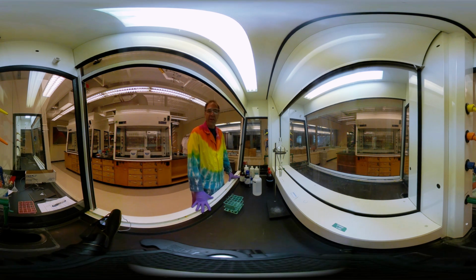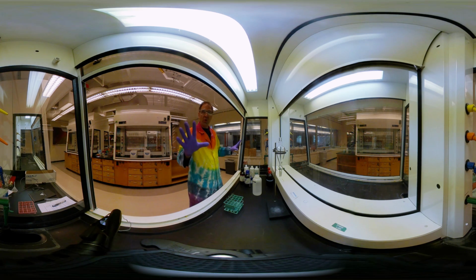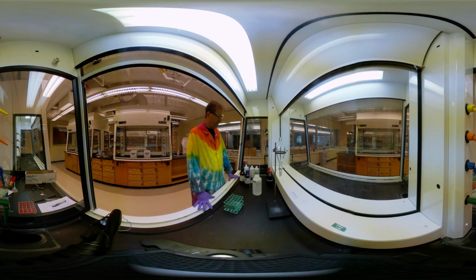We're going to be working on the second floor this year of the Atwood Chemistry Building. This room is very different than the one that you used for Chem 150 and 202 in that we have multiple fume hoods. Right now the camera's set up in the fume hood and I'm going to do the experiment in here. There's one fume hood for every 2 students.